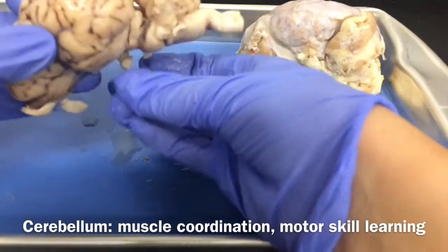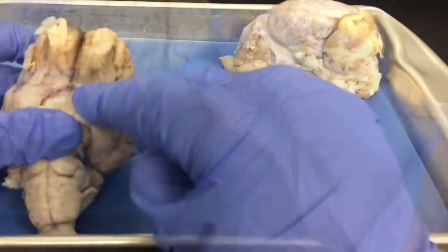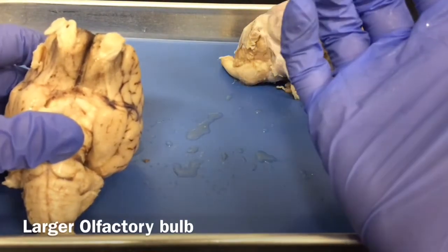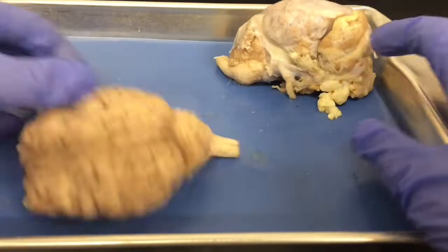Other differences in the sheep brain include where the spinal nerve attaches, the pons, the location of the medulla oblongata, and of course the olfactory bulb is going to be a little bit larger, or comparatively larger, on the sheep brain when compared with the human brain. Animals rely more on their senses and abilities of smell than humans do.